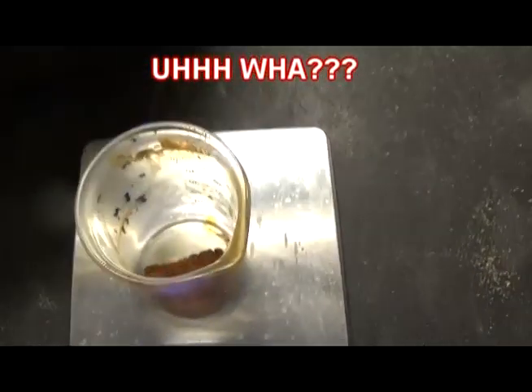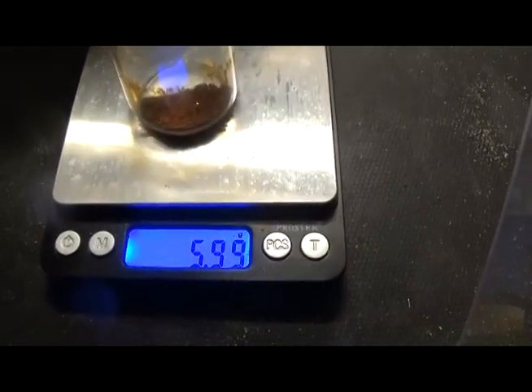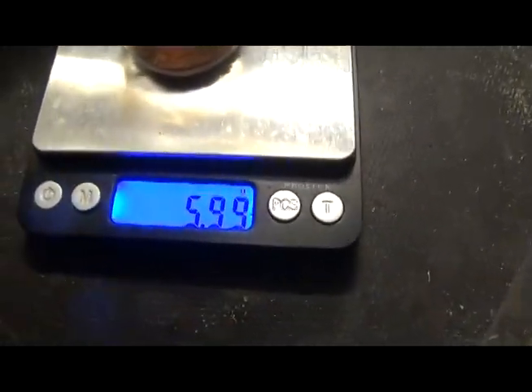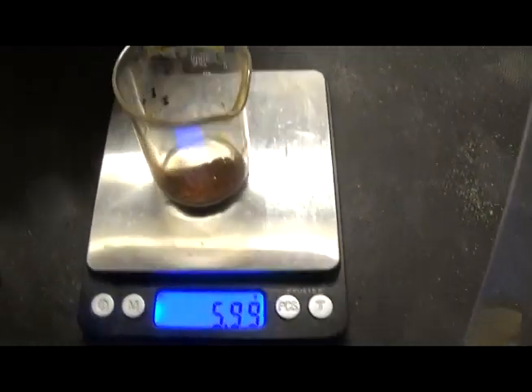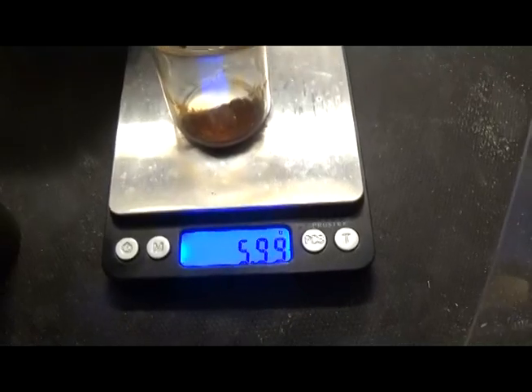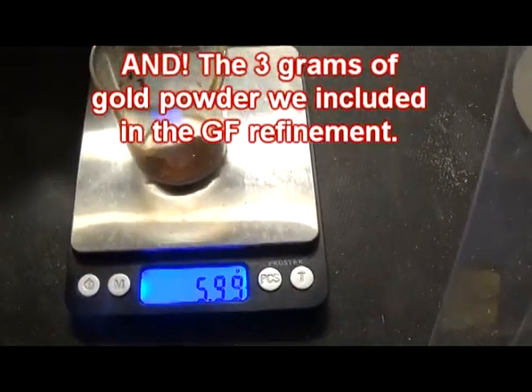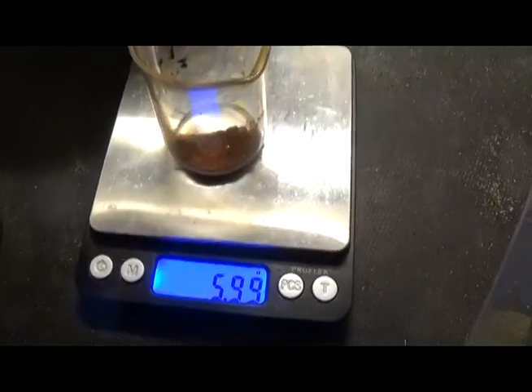Something ain't right here. Unless there was a lot of gold yield with that gold filled material, upwards of 3.5 grams worth. Actually, that's about right. That's what it should have come out to. So, we got roughly 6 grams of pure gold. Now, let's see if that tests out that way once we stick it in the furnace. We predicted 1.5 grams, but I didn't account for the gold filled material at all. And we had about 70, 80 grams, a little over 100 grams. Yeah, that's about right. 6 grams. Okay, we're going to get in the furnace.